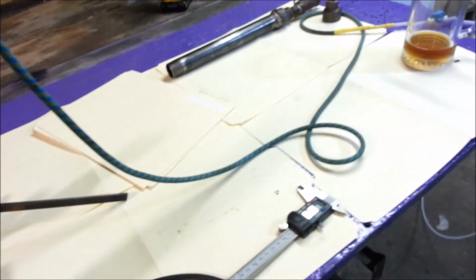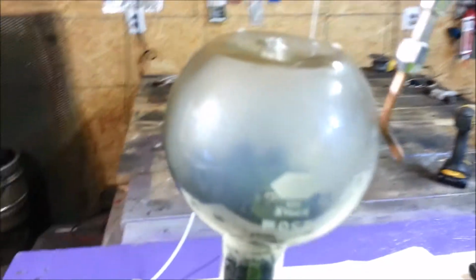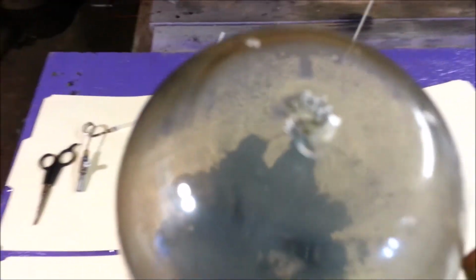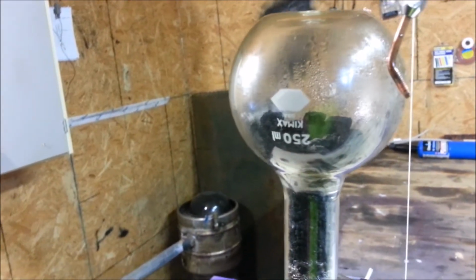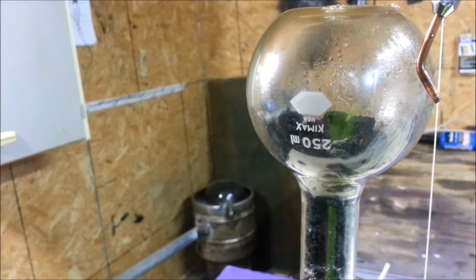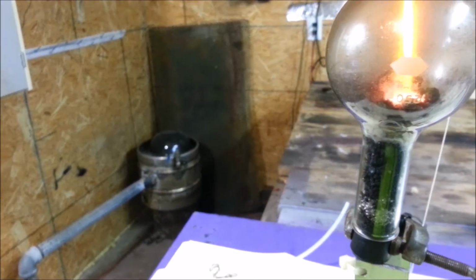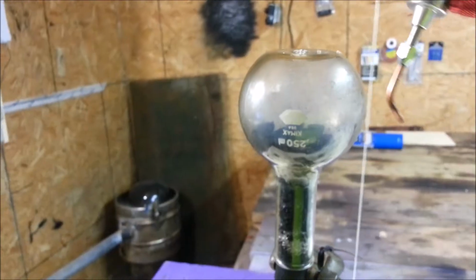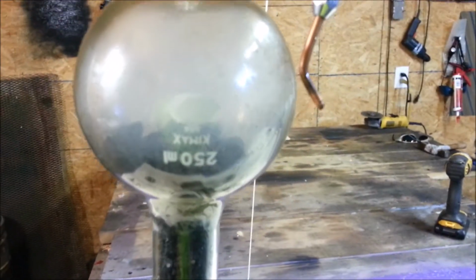It's been pressuring up. Yeah, I don't know why it's just going out on me like that. I'm losing my seal here. So I don't know what's up. I'm going to turn it up full power. Hopefully it'll stay lit long enough. I'm blowing all that HHO gas out of there so it doesn't blow up in my face. Okay, here we go. Probably going to be the last one. It's falling apart on me. Damn. Out again.